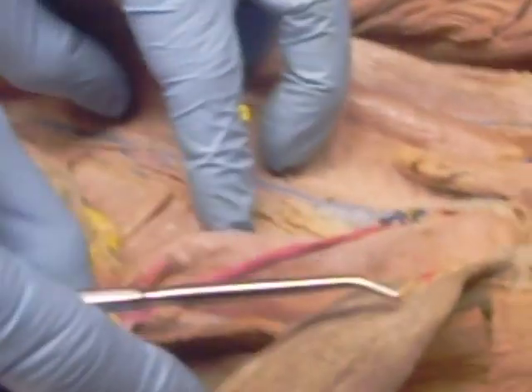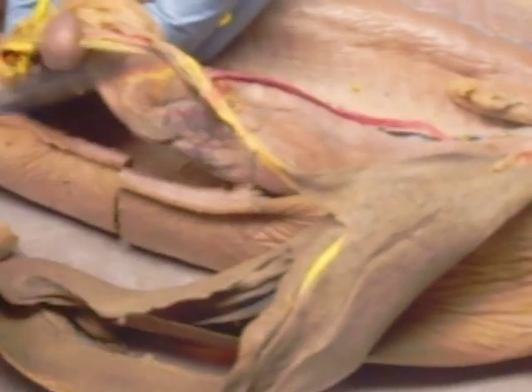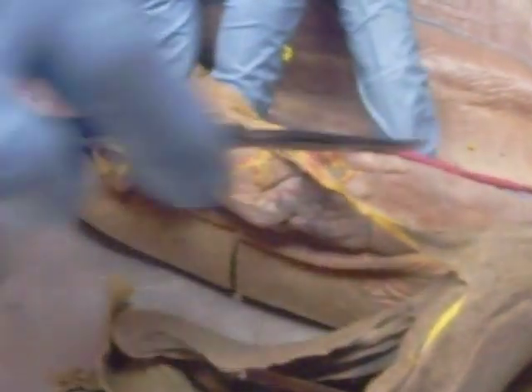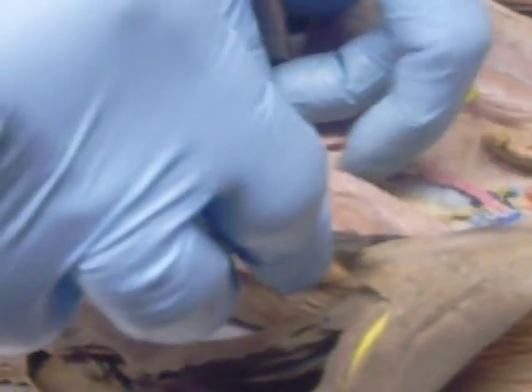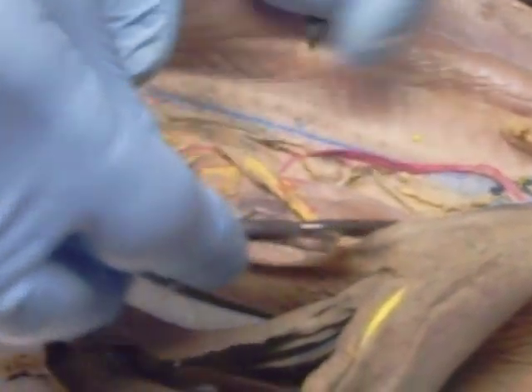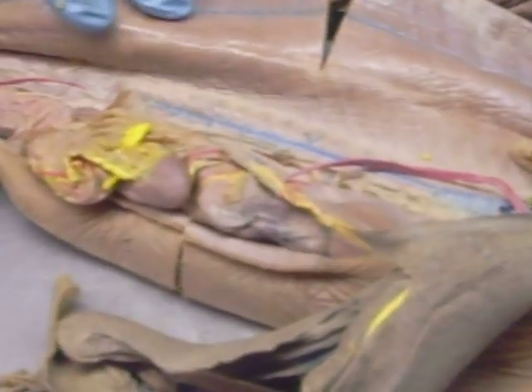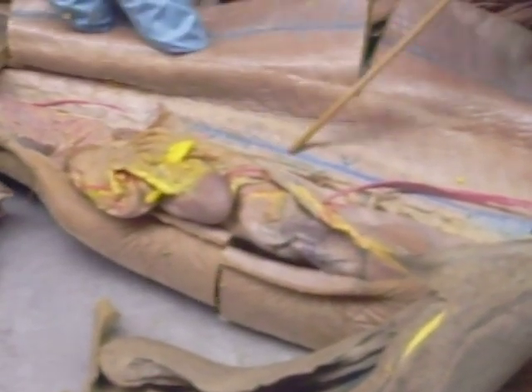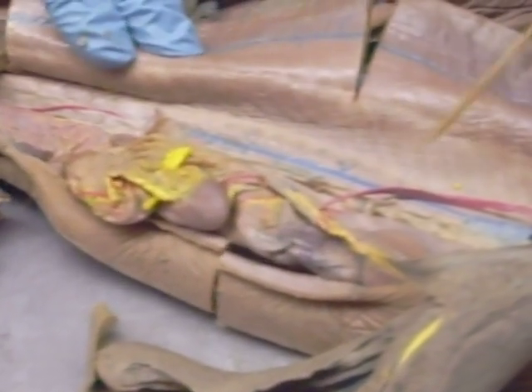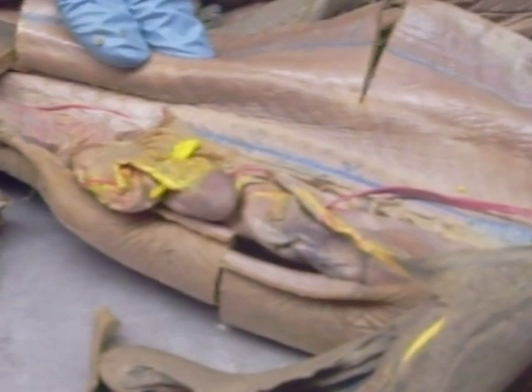And where's the celiac? The celiac is this big one here that comes off, and it goes to the stomach, goes to the spleen, just kind of like it does in humans — the celiac comes off of the aorta. So on this one, I'd really likely pin off the celiac. That blue one right there? That's the posterior cardinal — I'm not going to pin that out.